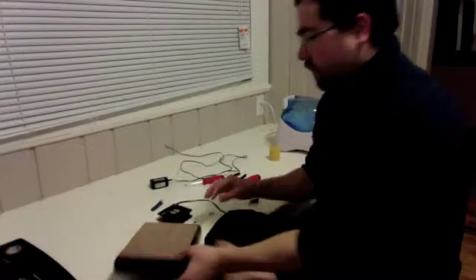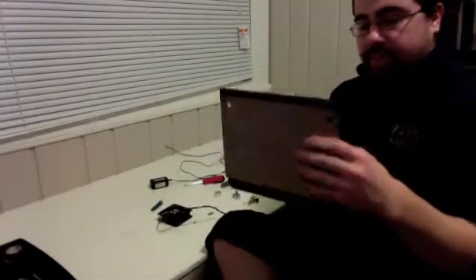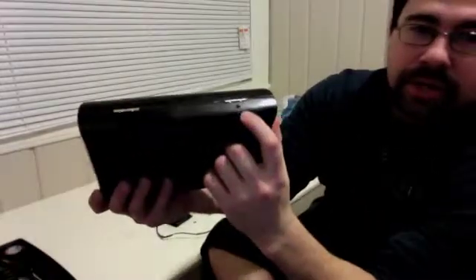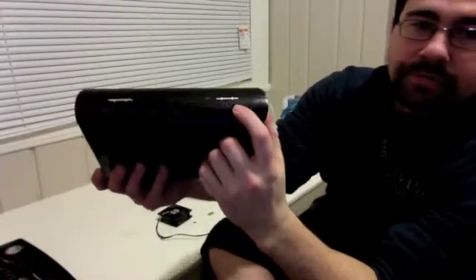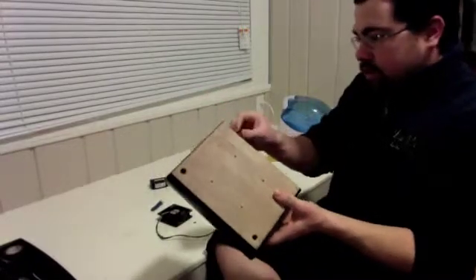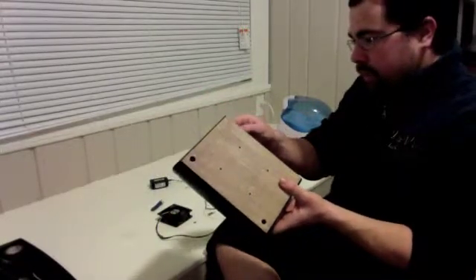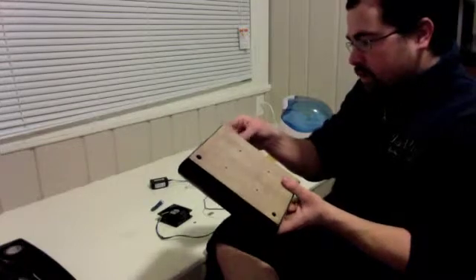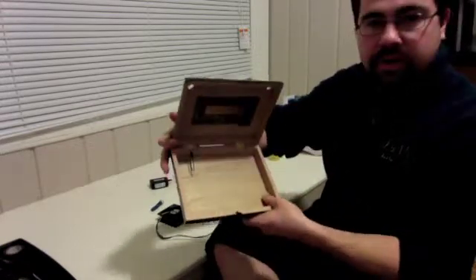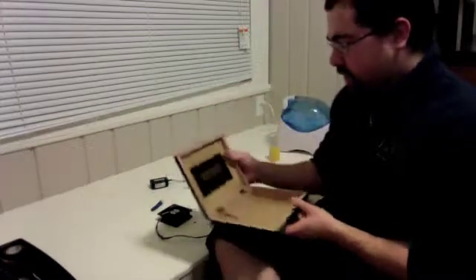And so the first thing I did was I bored a hole. You probably can't see it too well because of the black color here. And that's where this is going to go. You just feed this right through the back so that it goes right on the inside here. Simple enough.